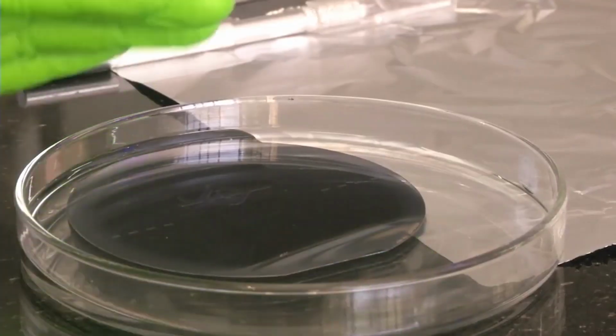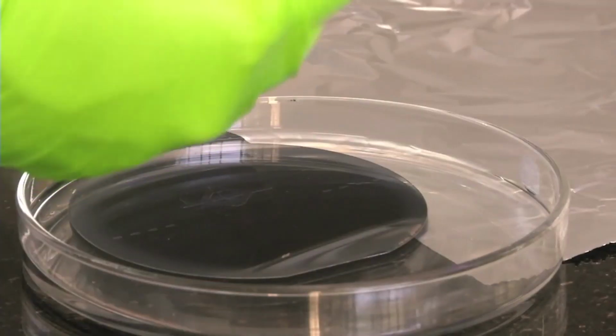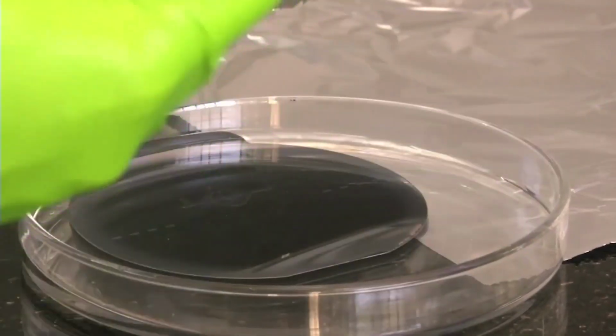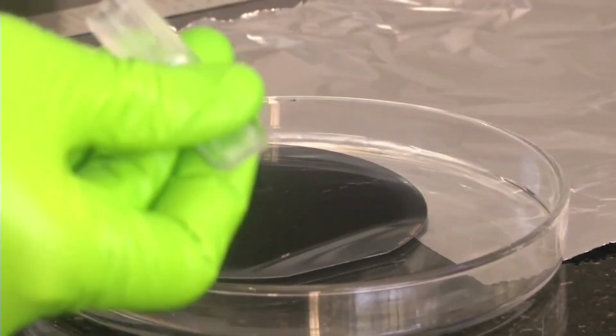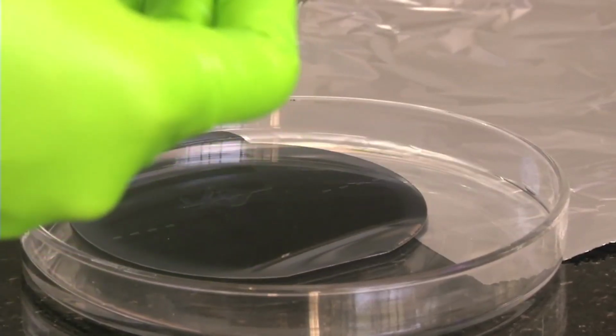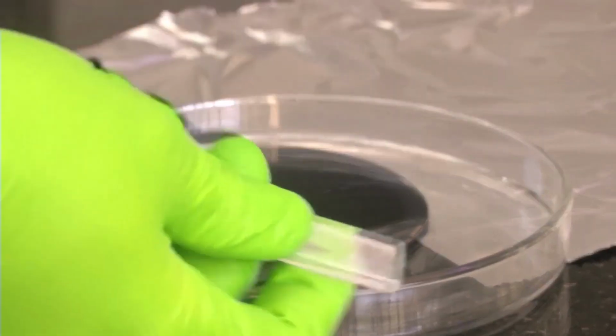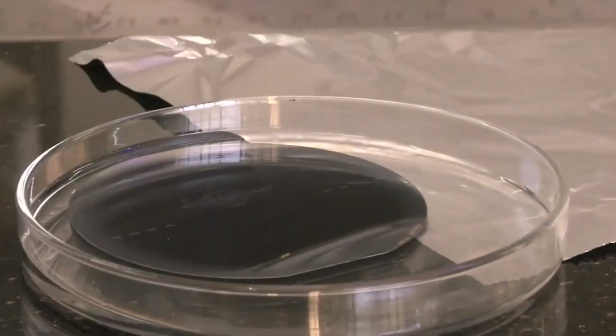For cutting out the PDMS from the glass petri dish, the main things that we need are a very sharp knife so that we can make fine features on the PDMS membrane, and a metal scale. You need a metal scale because the cutter should not cut the plastic if it is a plastic scale.